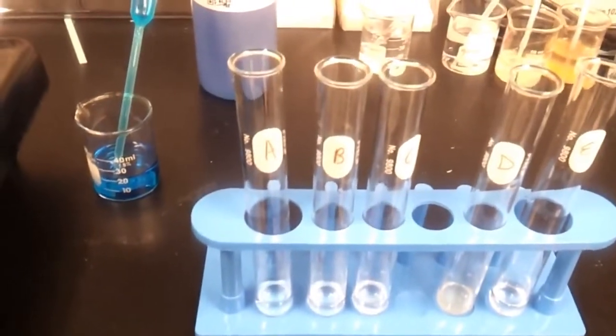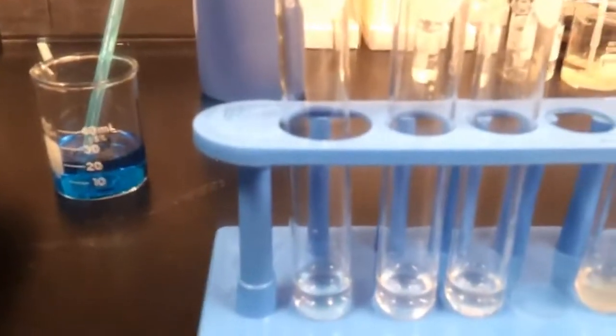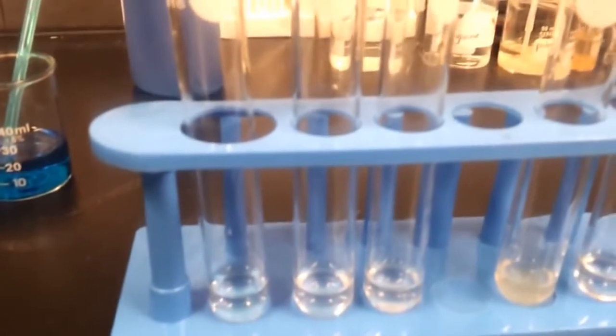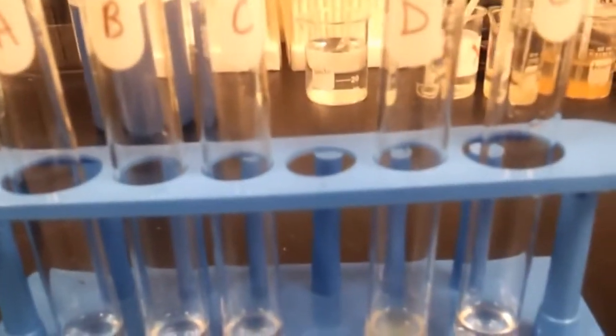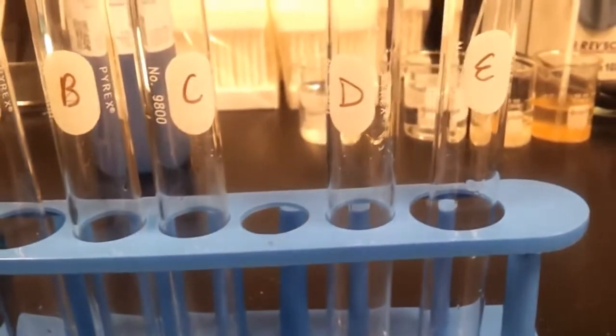Again, just for clarification, A is just a water solution, B is a glucose solution, C is potatoes, D is tomato juice, and E is starch.